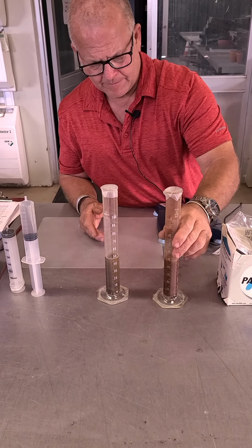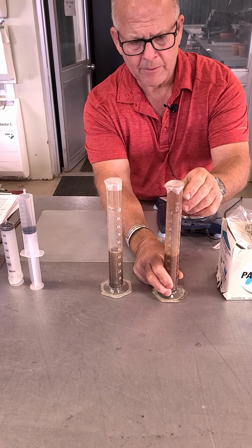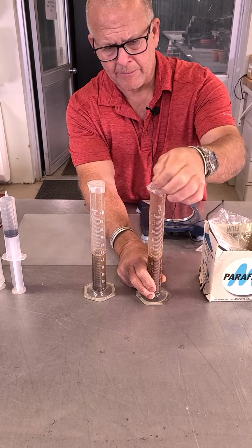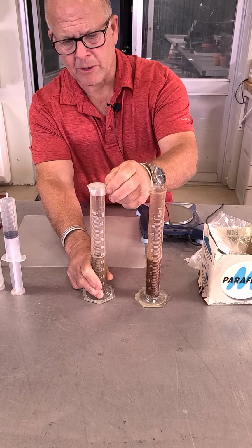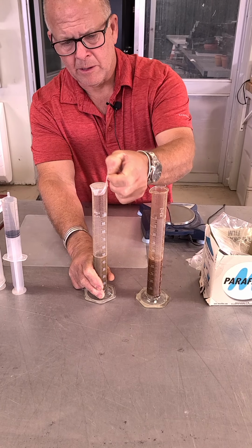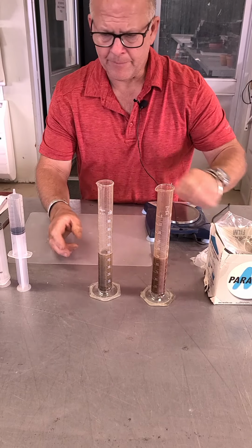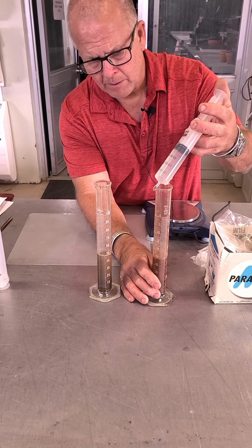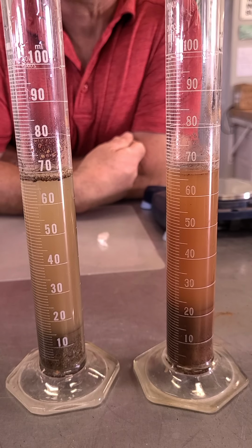All right, so now you can see I've got some sample there on the side again. So what we're going to do with that is, I mixed it up. I probably should have done that before, but it'll work this way too. I'm going to try to add another 20 to this to get all those particles down on the side. All right, so another 20 on this one, and then I'll be back and show you this in just a second.